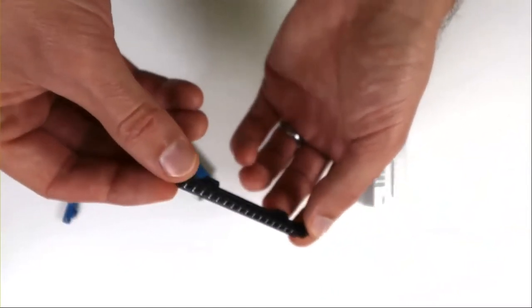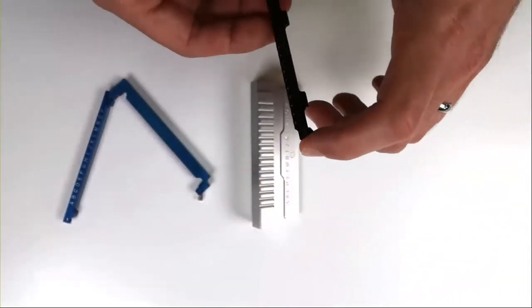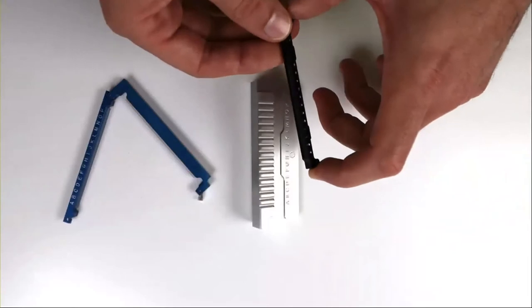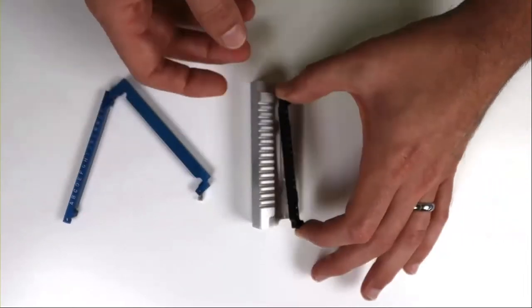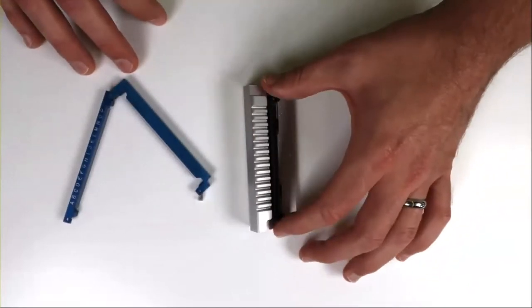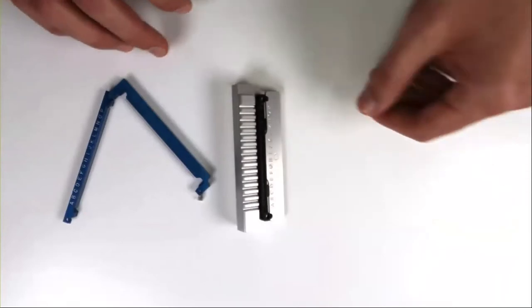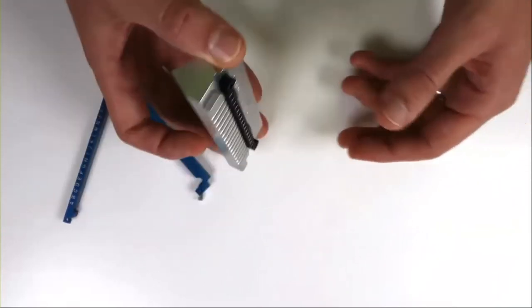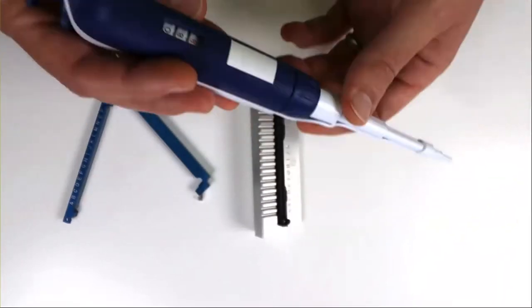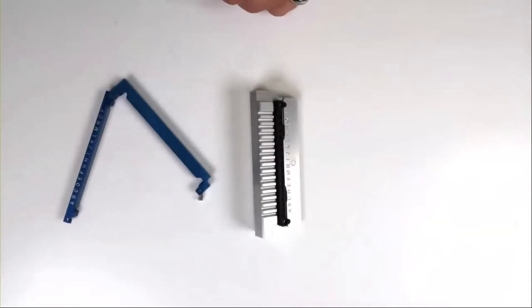I want to emphasize the Uni's aluminum frame, which is great for heat transfer. Now I want to show you how to load this Uni and get it ready for an experiment. You'll notice I'm not wearing any lab coat or gloves since I'll be loading with water for the demo. The first thing about the Uni is that it's actually magnetized — on the loading tool, you can just drop it in and it snaps right into place. We won't have any issues with the Uni being misaligned. Next, I'm going to take a classic P20 pipetter at 8.8 microliters and aspirate up a little sample of water.